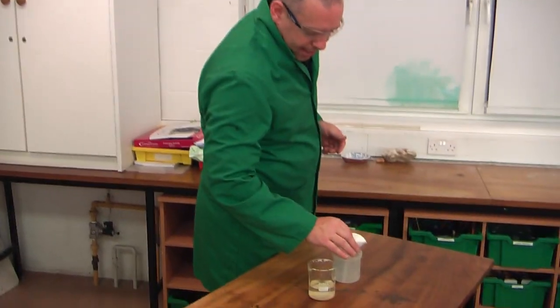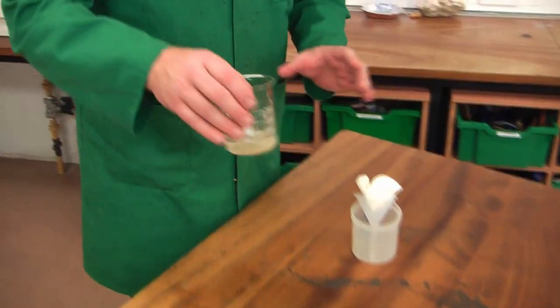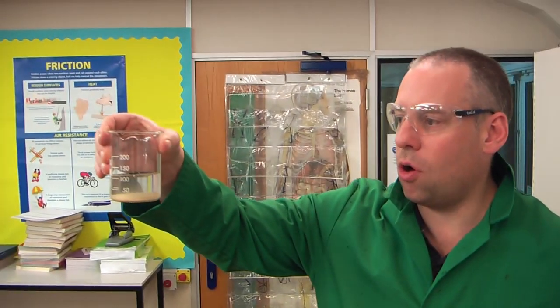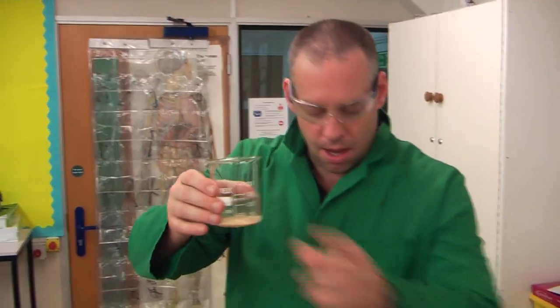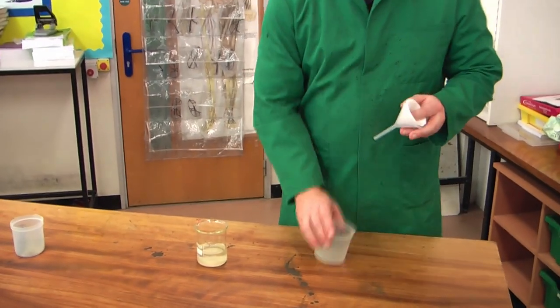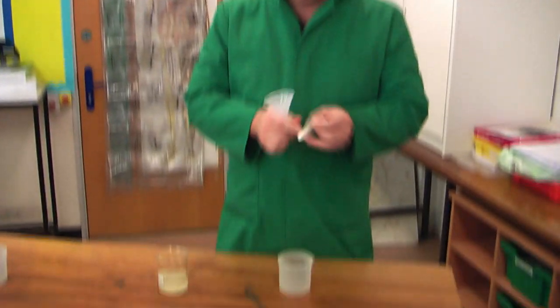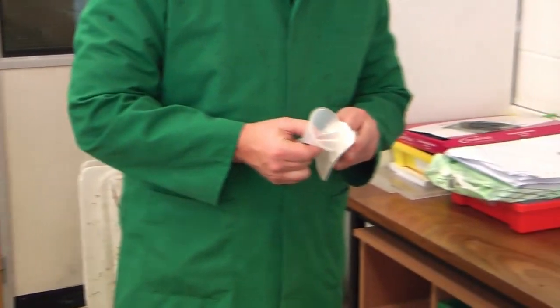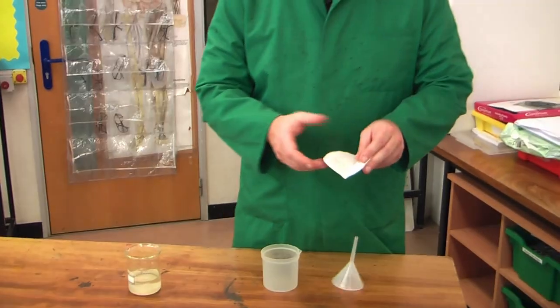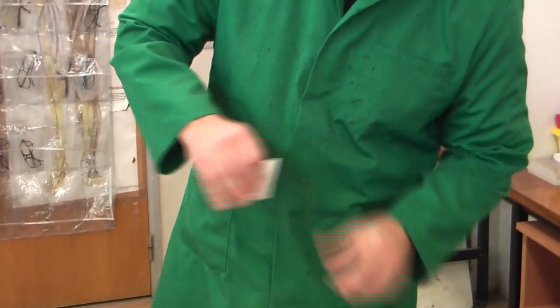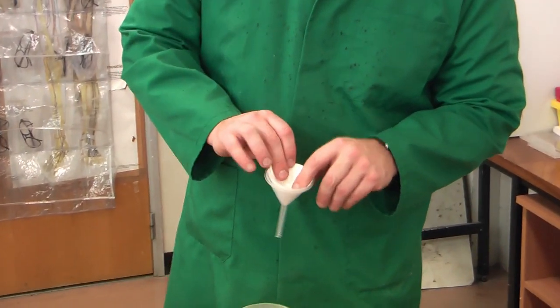Our fourth technique is what to do if I've got a mixture of a solid that is insoluble, that will not dissolve inside water. So here I've got water and sand and I want to separate them. So to do that I'm going to need this little setup here. We've got some names. This is called a filter funnel. This is called a filter paper. Filter paper is very easy to set up. I've got two in there. You take a piece of paper, you fold it in half, you fold it in half again and you then open up on one leaf and we've got there a filter paper that's ready.